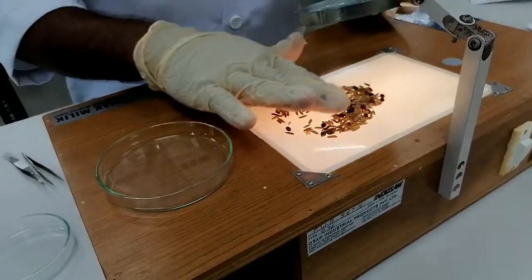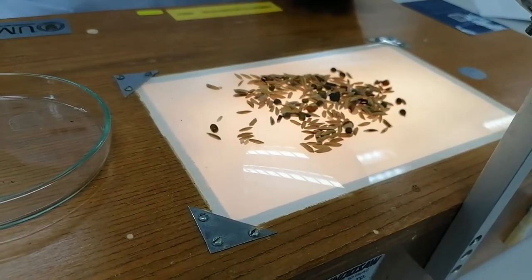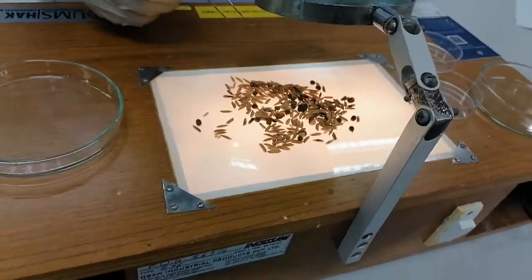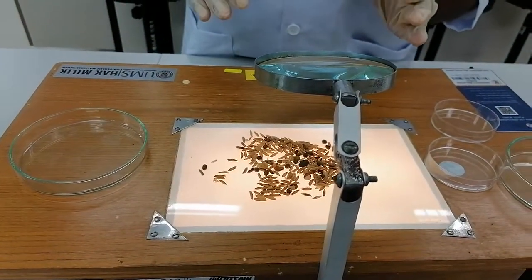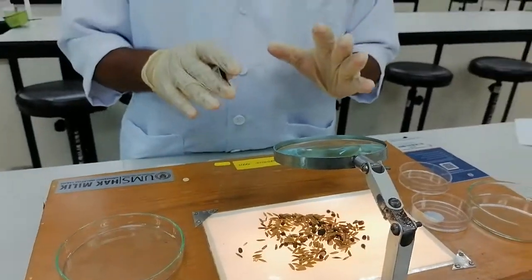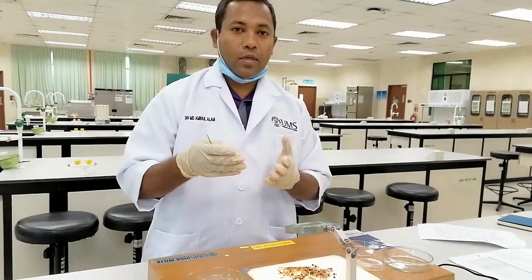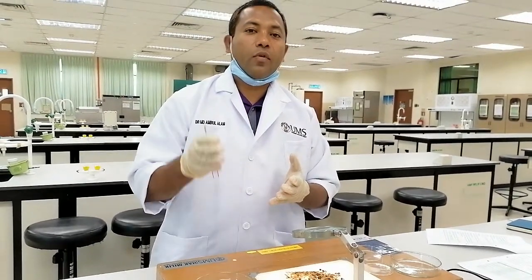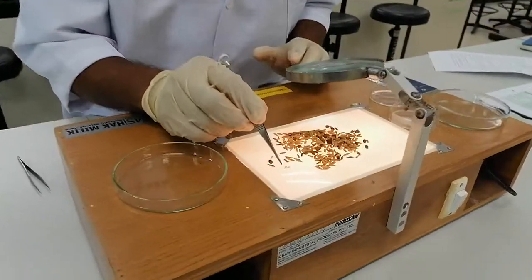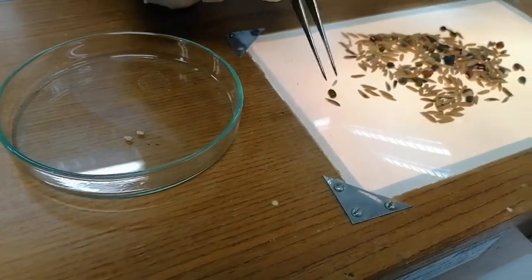After that, there is a power glass — you can see it easily, and the size appears bigger. Our main seed is rice seed. We have to separate one by one what types of other materials are inside. For the pure seed, this rice is the pure seed. Remember that shriveled — that means deformed — or even germinated rice seed is also considered pure seed. Even broken rice, if the size is more than half, is also considered pure seed. If less than half, then it is inert matter.